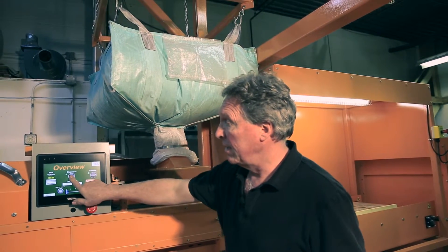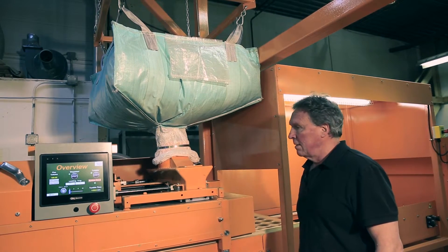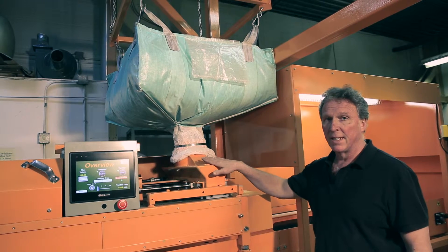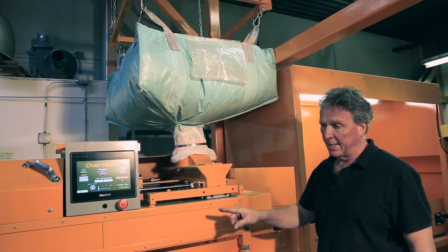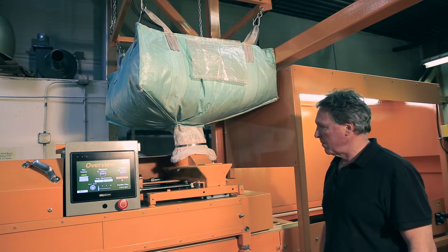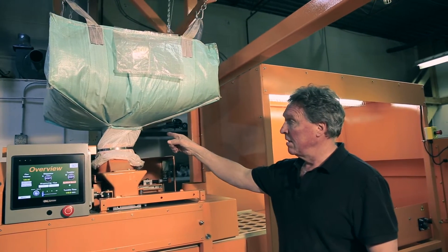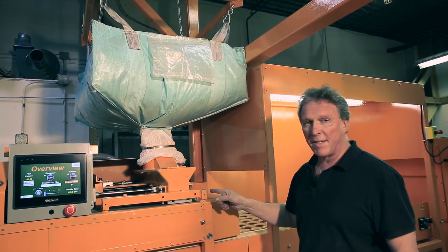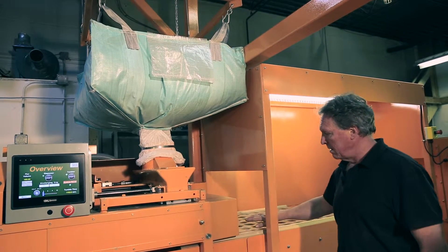Now that we've attached the bag to the hopper, we're going to demonstrate the machine servicing a tray of crucibles — three rows in the tray. We've selected the appropriate selectors on the machine and removed the cover so you can see the moving parts. The green light tells me everything is good. I'll hold it in for three seconds and the tray moves in — everything else happens automatically. The machine first finds the tray's position automatically, then repositions it directly under the hopper ports. The hopper moves back and forth to provide agitation, then dumps flux into the cups and they're fully serviced.